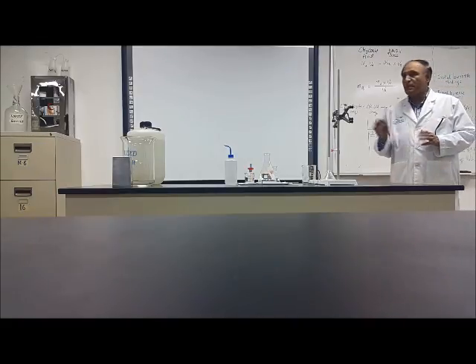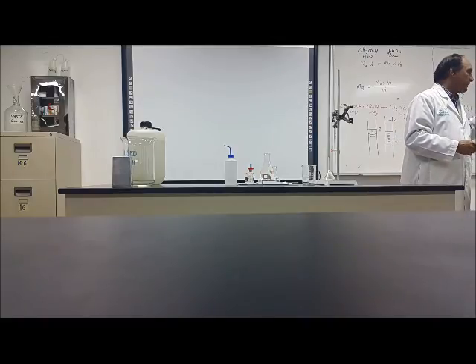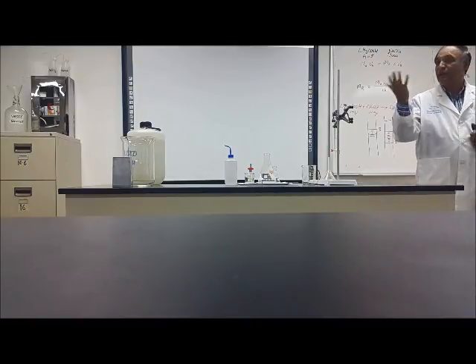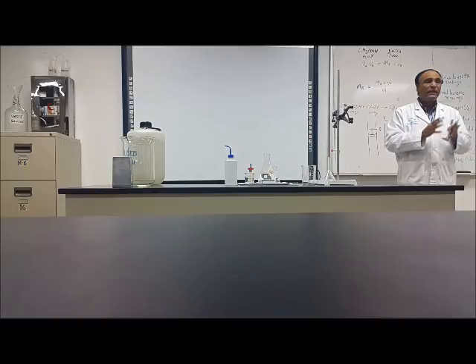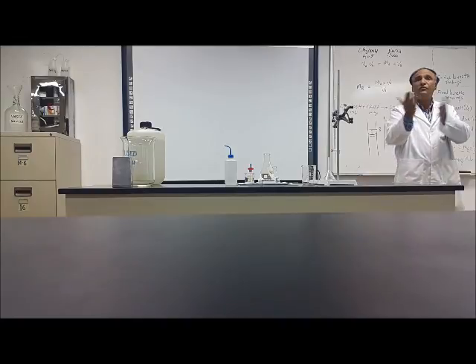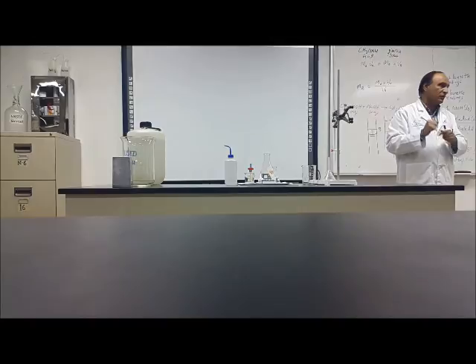When you do this experiment next time, two students will do it together. For example, look here, 1 and 2 will do it together, 3 and 4 like that. Two students will do it together. Because you are doing it for the first time, you can help each other. When the two students are there, each student will do his own work. I will tell you what work one student is doing and what work the other student is doing.